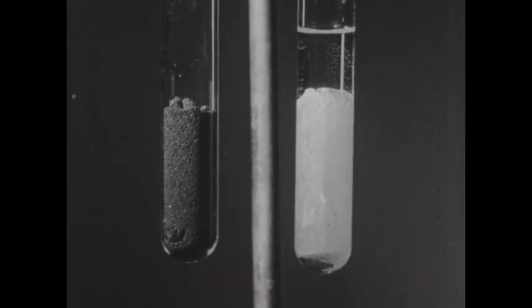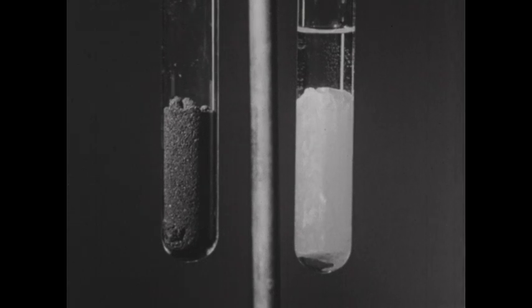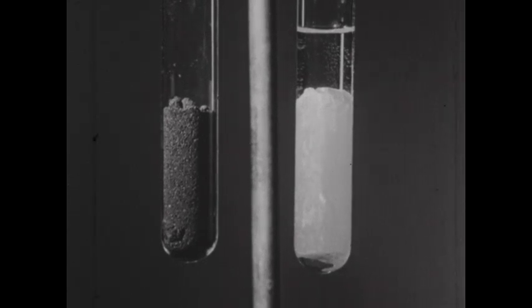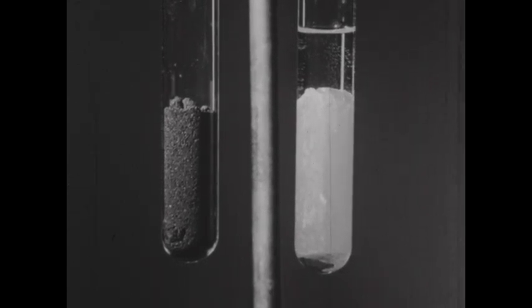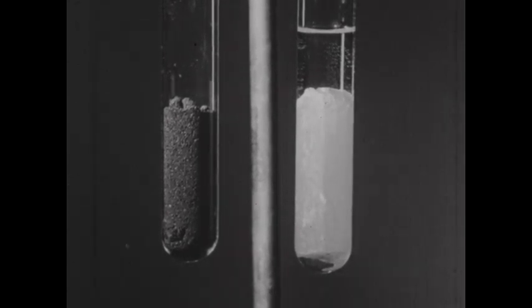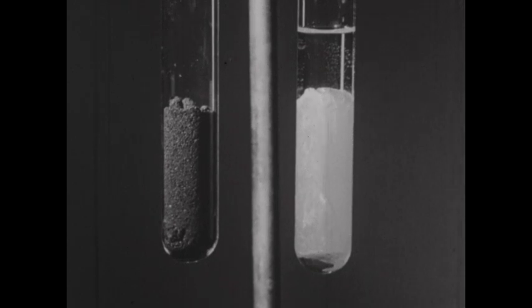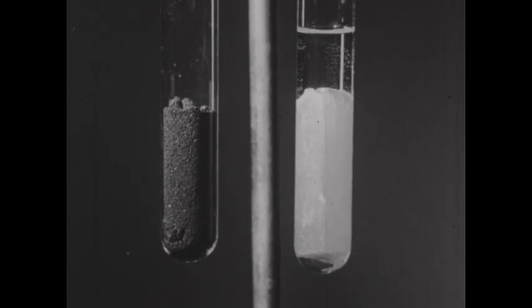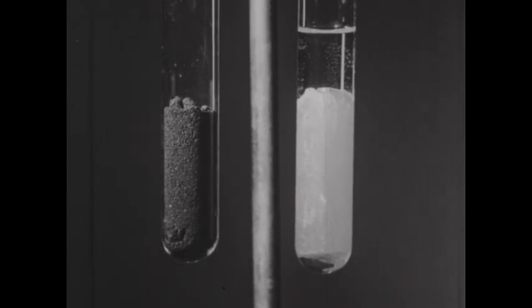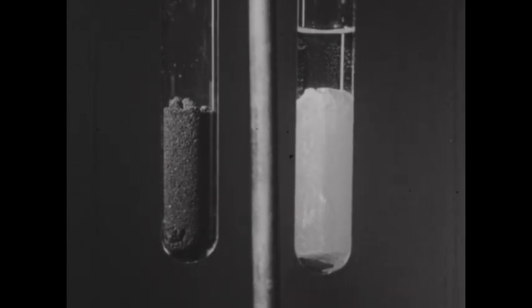For this reason, the piece of phosphorus in the tube has a yellowish appearance due to a small surface coating of the red variety. Red phosphorus occurs in the tube on the left — it's the stable form at room temperature.